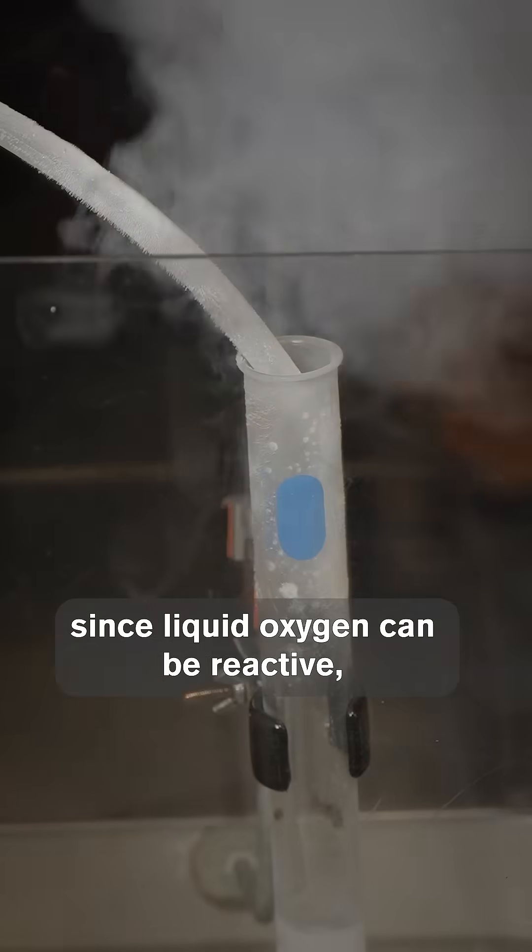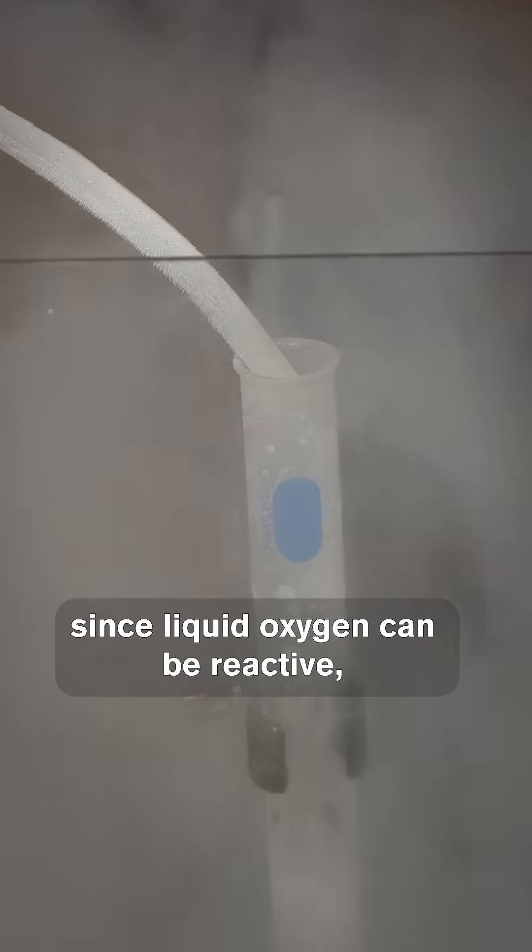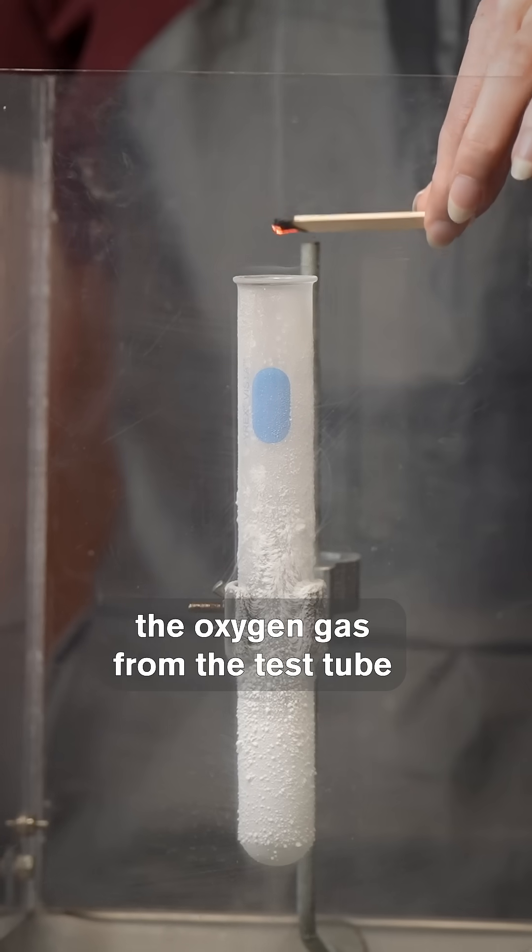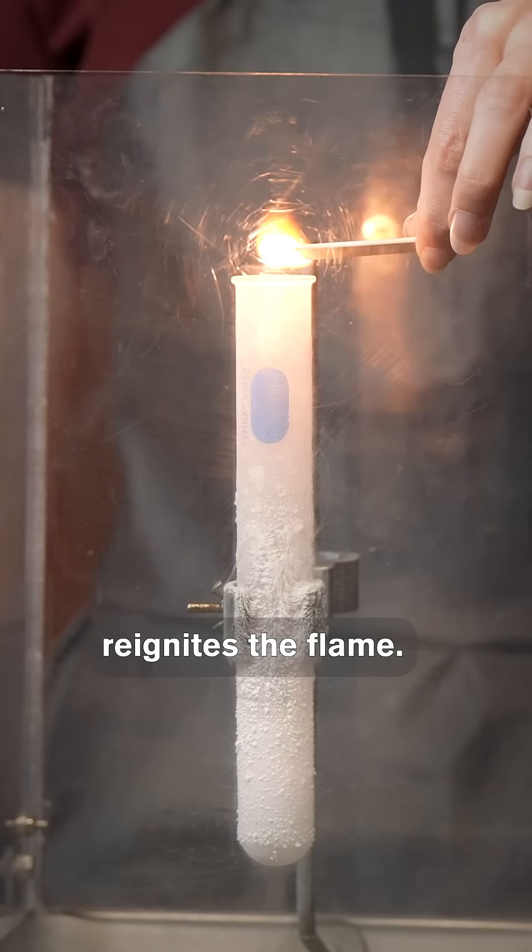For safety reasons, since liquid oxygen can be reactive, we're using a very small ember. If I hold the ember above our test tube, the oxygen gas from the test tube reignites the flame.